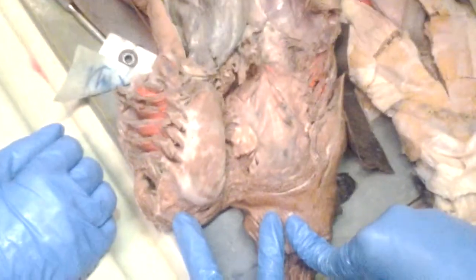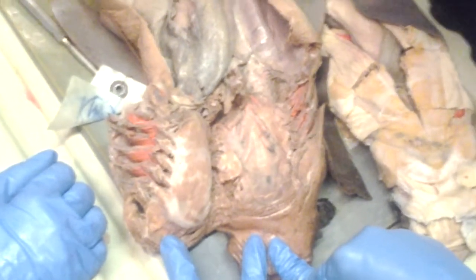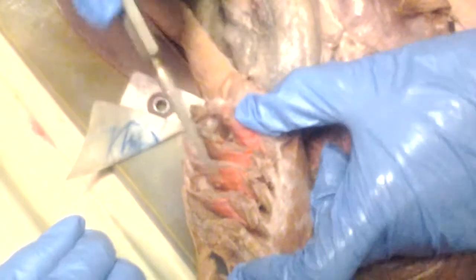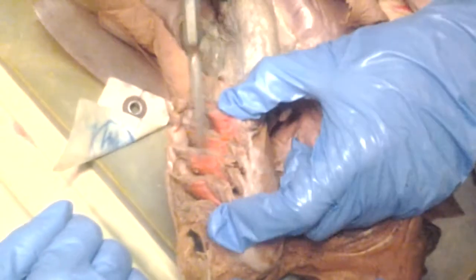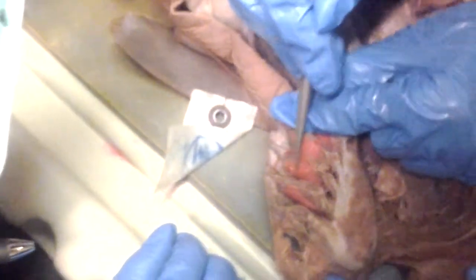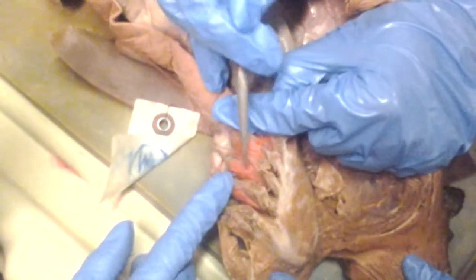We didn't really go over that. What are the lamellae? Is it the red? It's the brown part, really. The red is little blood vessels. Actually, it's the brown stuff under here. The brown stuff is the lamellae. And the brown stuff are the rakers? No, the red is the blood, the blood vessels. Are the gill lamellae also known as gill rakers?